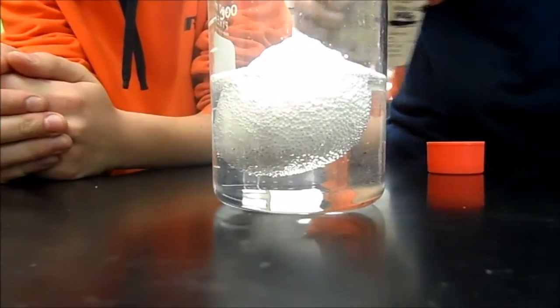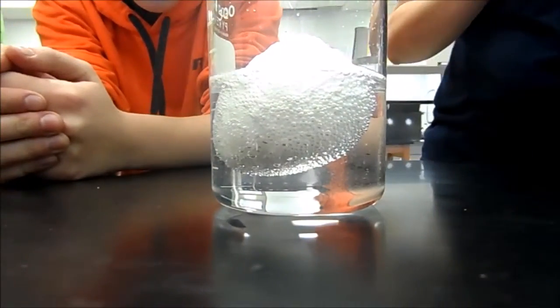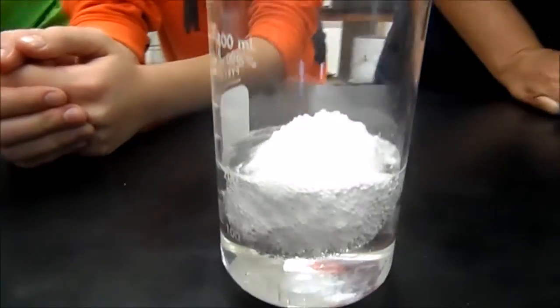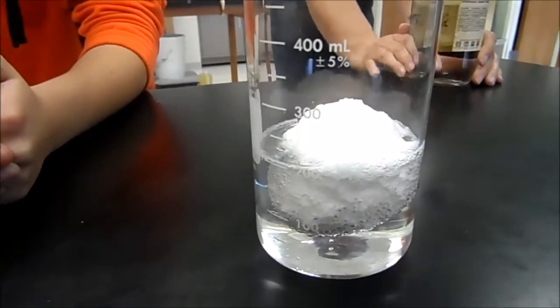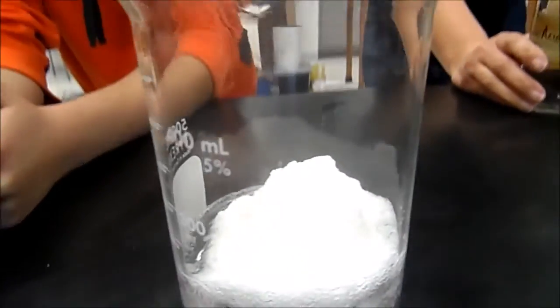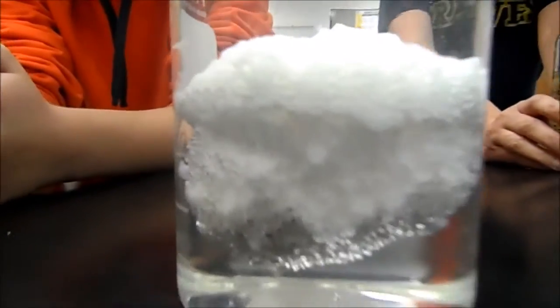Is it expanding? What's the reaction? So that foamy stuff is the nitric acid reacting with calcium carbonate. It's like a gigantic marshmallow. Don't eat it, it's like styrofoam. Do not put that in your mouth.